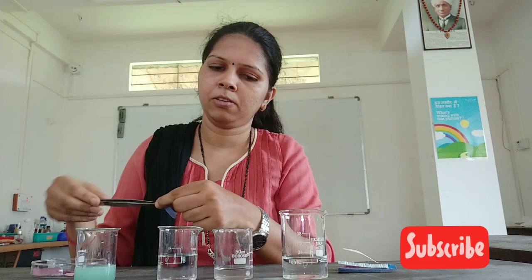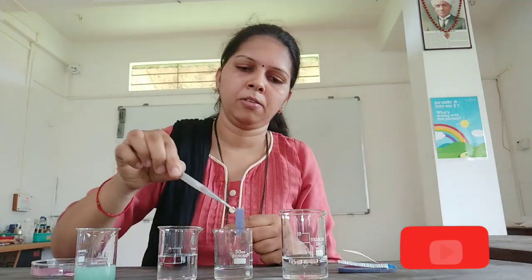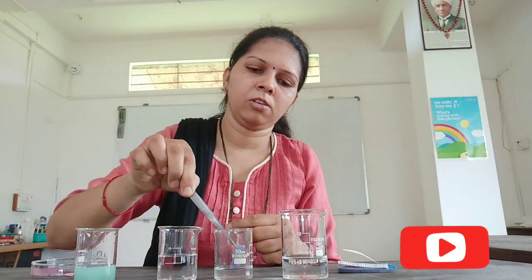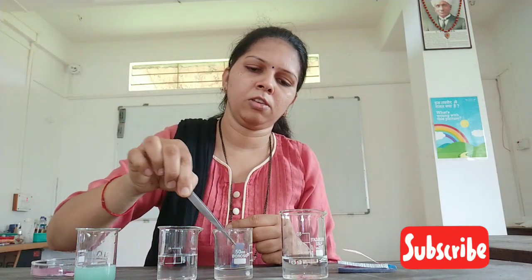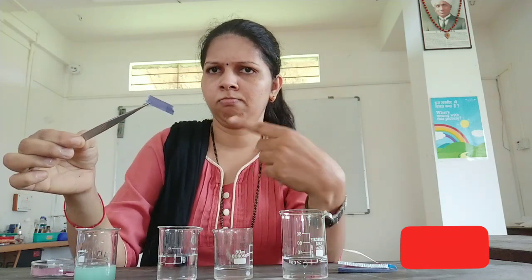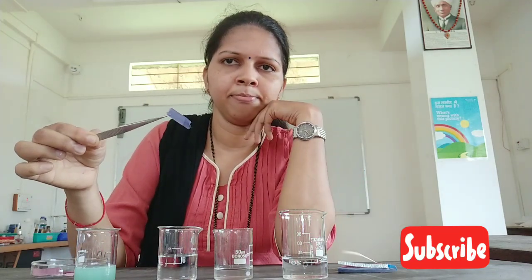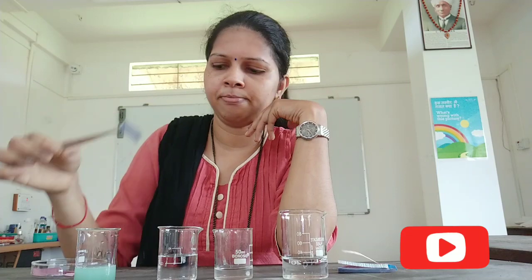Let's perform the same test for beaker B. Let's take the blue litmus paper and dip it. Did you find any color change? No, it did not change.